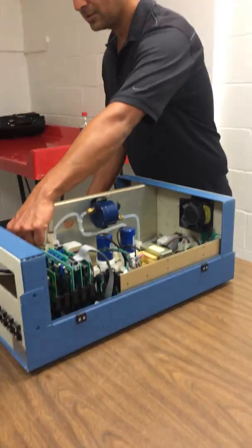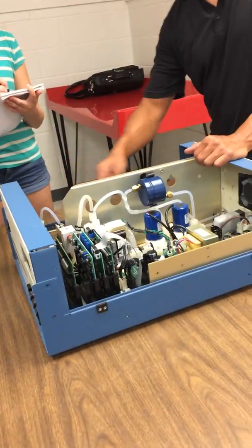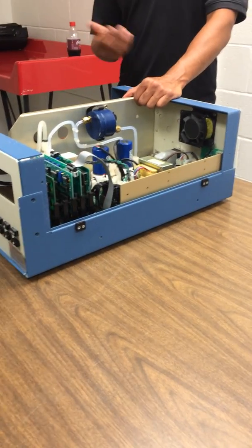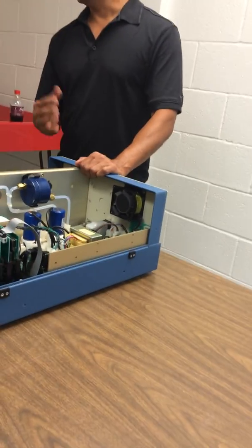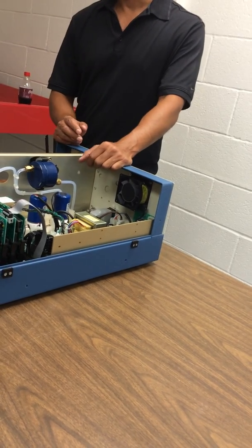Cells have flow meters and 2 detectors. One of the things you have to consider in any absorption measurement is that some gases absorb light differently, even particles. Sometimes it depends on how the manufacturer did the measurement. You have to worry about interferences.